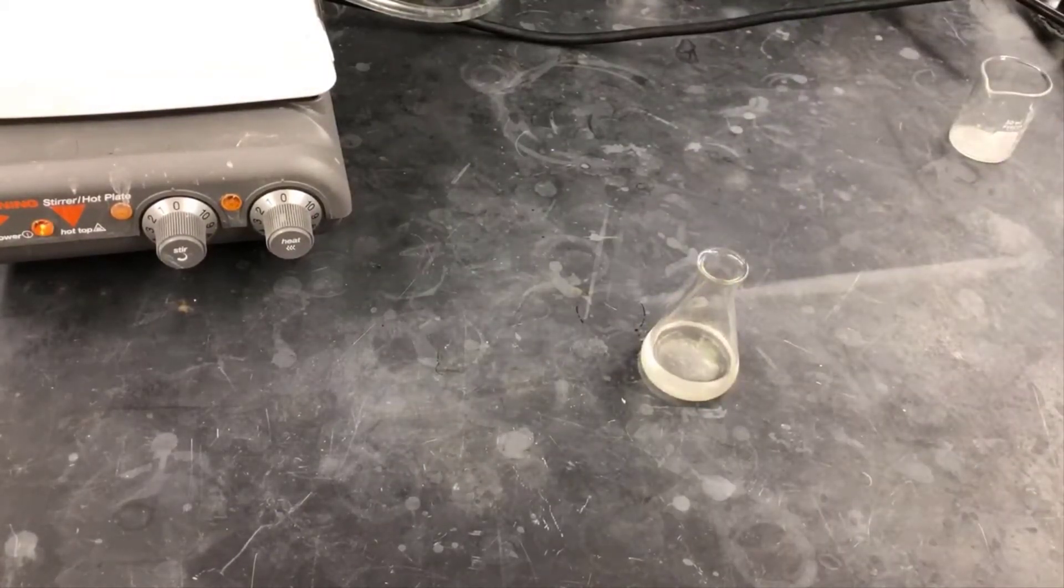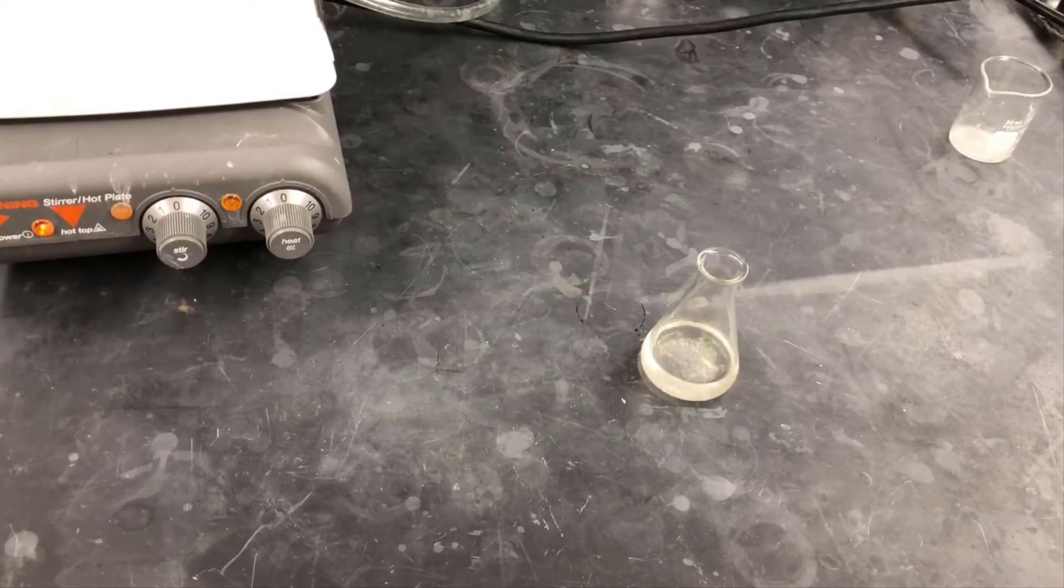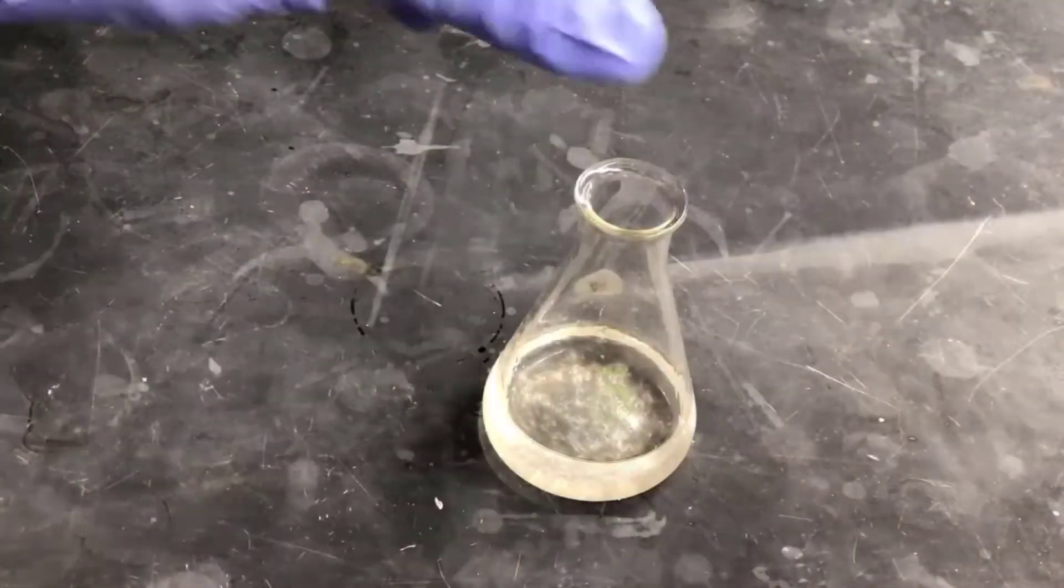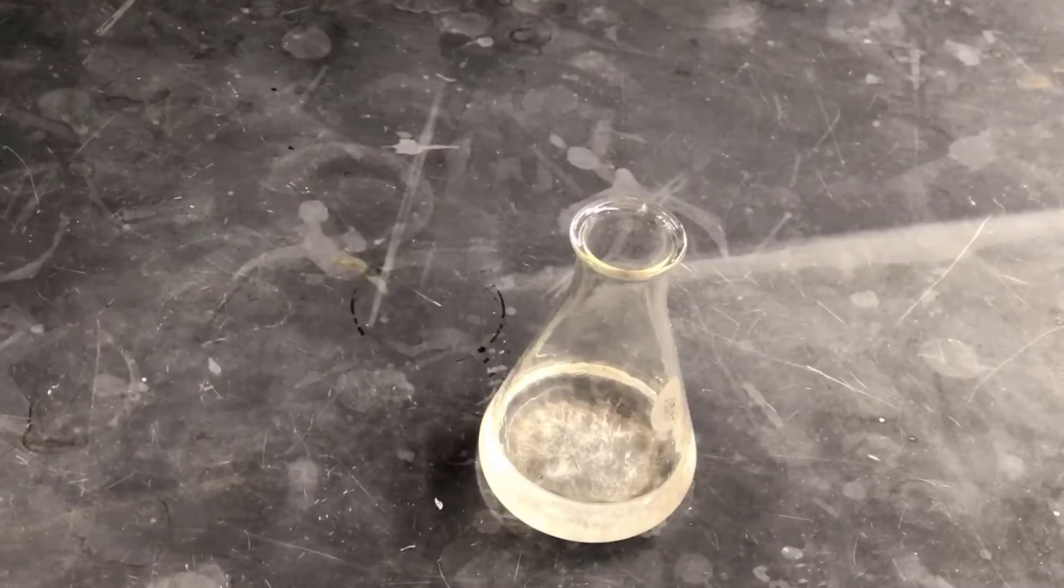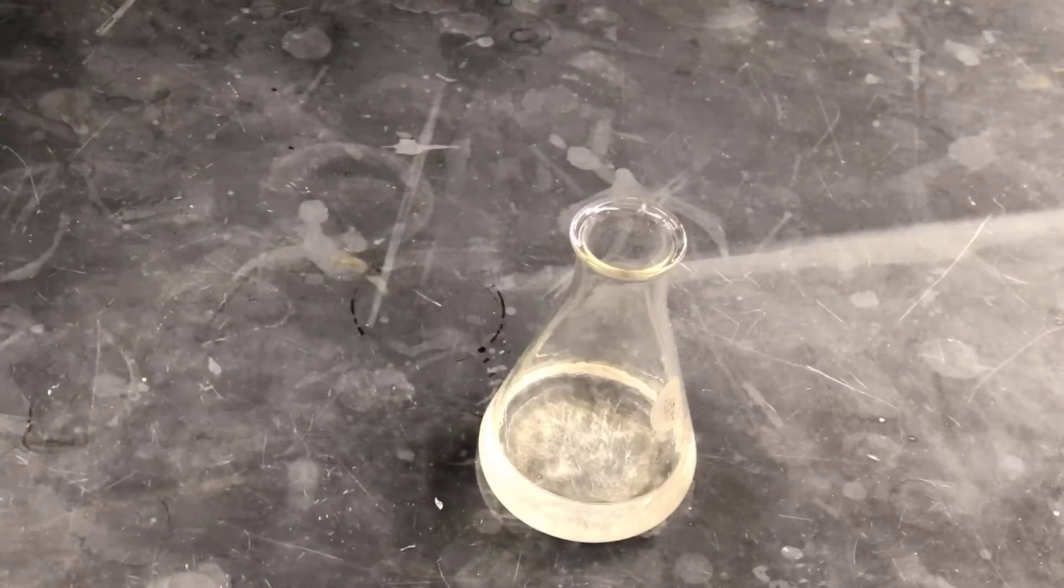I can see a few crystals start to develop in the flask, so I'm done adding petroleum ether. Now I'll just watch and wait for the crystals to grow. It's a good idea to allow the solution to cool to room temperature on its own slowly. Crystals that grow slowly tend to be of better quality and higher purity.